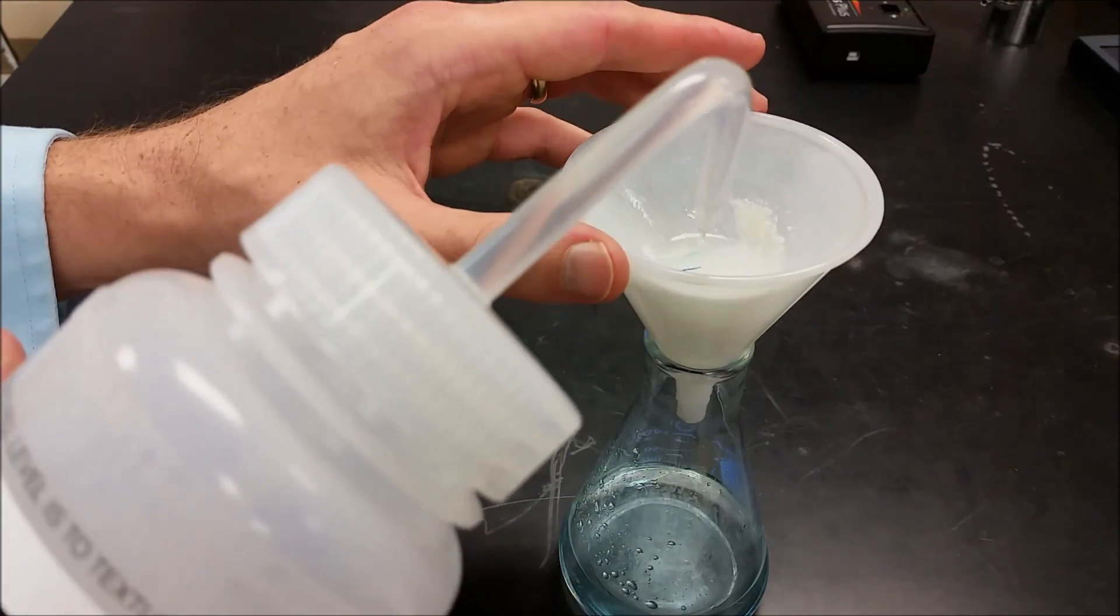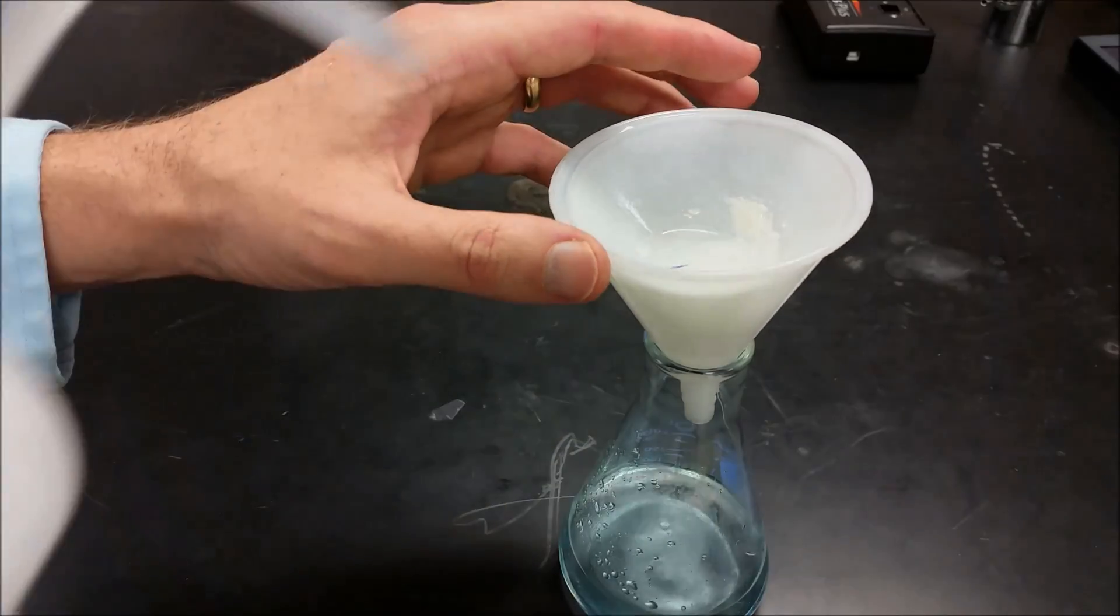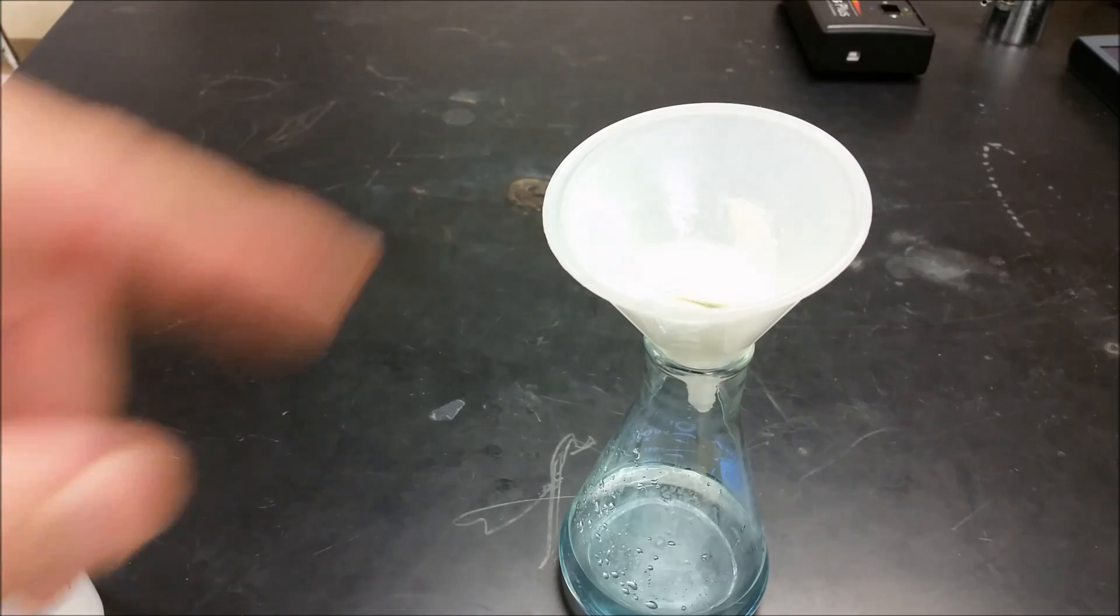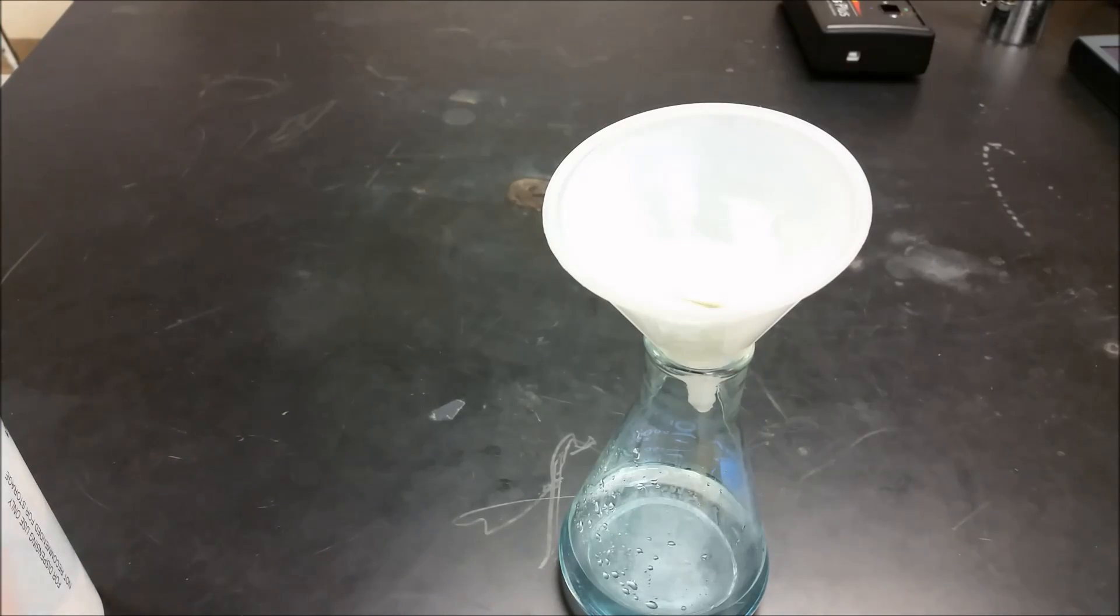In fact I can see a little spot of blue right here. I'm going to try and get with some water. And we want that to go through so that our mass is just the barium sulfate precipitate and nothing else. So we're going to let that wash one more time. And then we're going to let it dry overnight. And then we'll come back and get our mass. And we'll be able to figure out our concentration.